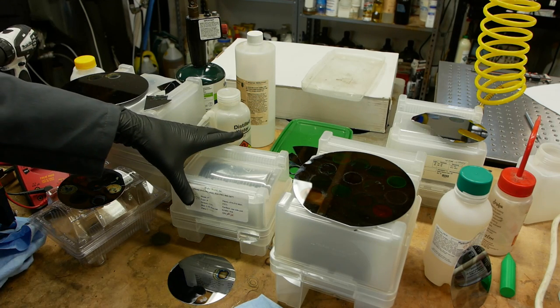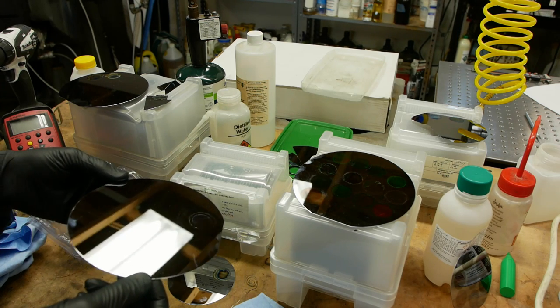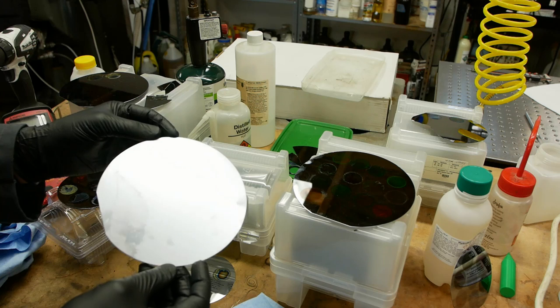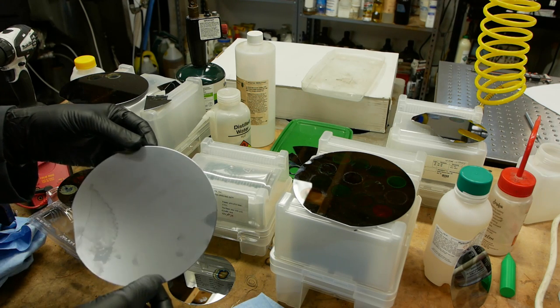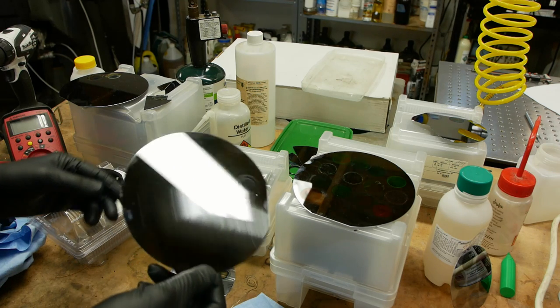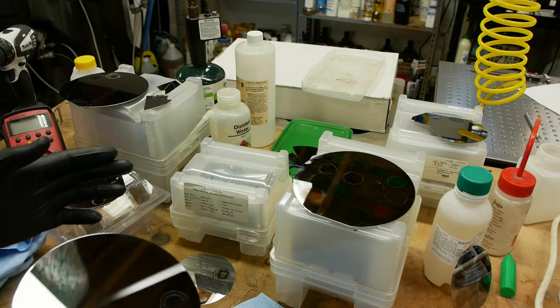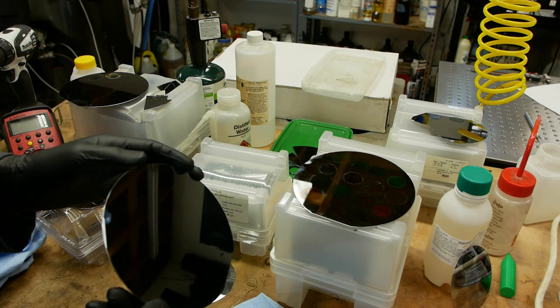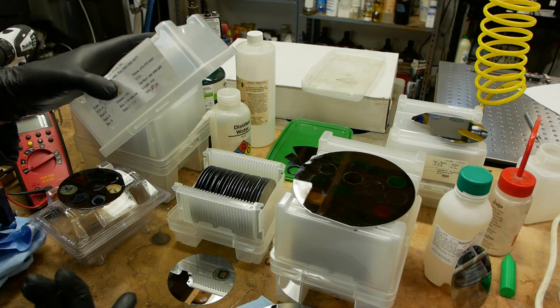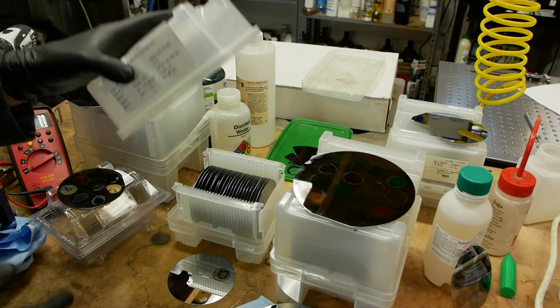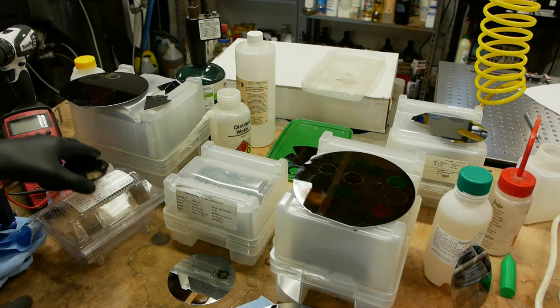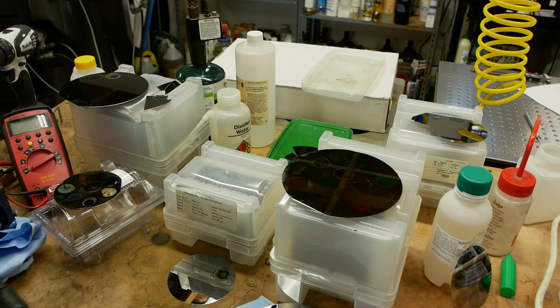There are quite a few different kinds of silicon wafer in the world. And the ones that work best for this experiment are p-type that are heavily doped. And that's not a Cheech and Chong reference. That just means that these are very electrically conductive. So silicon by itself is not a very good electrical conductor, but if you add something else to it, you can actually make it relatively good in terms of conductivity. And for this experiment, you want the most conductive ones you can find. So these are about 0.01 ohm centimeters, heavily doped. The p-type wafers are generally not photosensitive, so you can etch these in kind of whatever conditions you've got. The n-type wafers are photosensitive, which could be interesting if you wanted to pattern this. But it still adds another wrinkle of difficulty, and I think you might actually have trouble getting enough illumination on there to build a filter the way you want. But anyway, the other things like the thickness of the wafer and the crystallographic orientation and everything else don't really matter that much as near as I can tell.